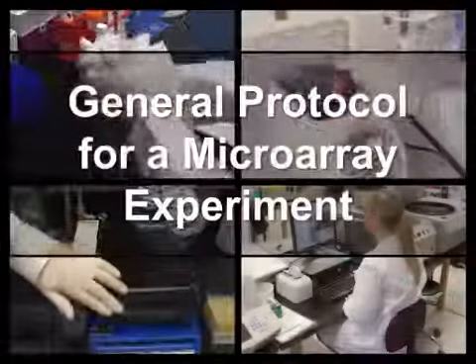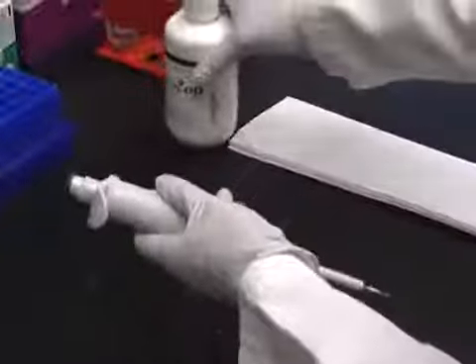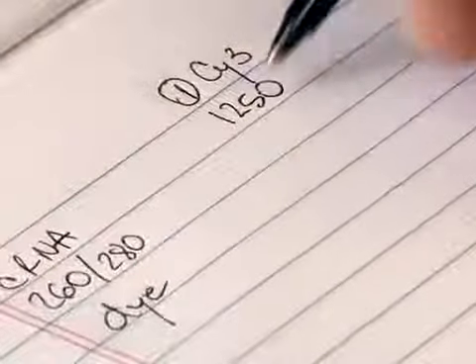Now that we've discussed the principles of microarray methodology, let's take a look at a typical microarray experiment. To ensure the quality of the isolated RNA, workplaces and equipment should be treated with chemicals that inactivate RNases, enzymes that would otherwise destroy RNA. The RNA is then isolated from samples of interest and purified, and its concentration and integrity are determined through spectrophotometry. This sample RNA is converted to cDNA and then cRNA. Next, the sample is labeled with fluorescent molecules and fragmented, and its quality and quantity can again be checked, at which time the extent of fluorescence labeling can also be assessed.